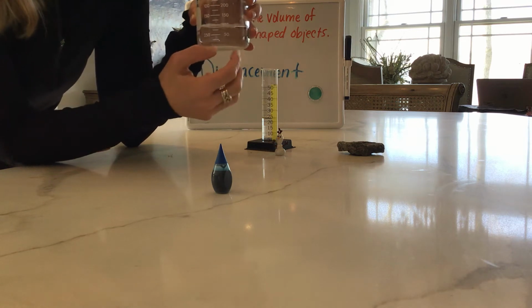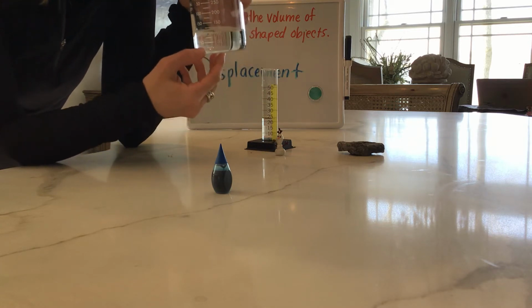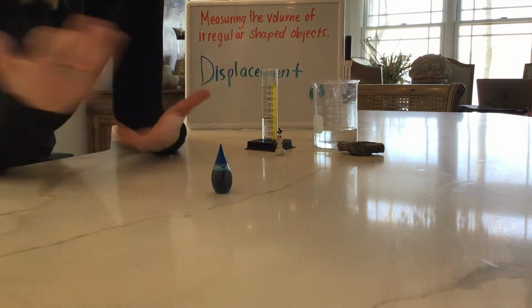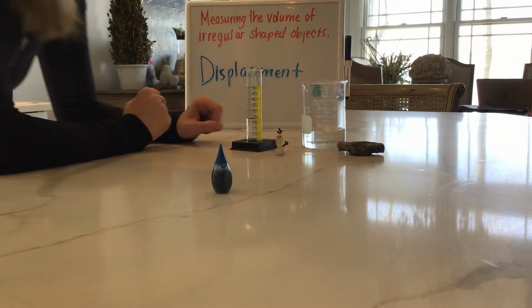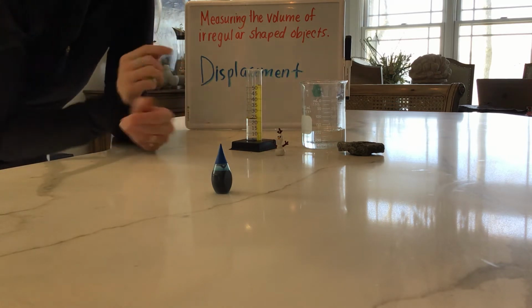So when you're looking at a measuring tool for liquid, you always have to look carefully at what the number is on the beaker, because sometimes it could be 5s, sometimes it could be 25, sometimes it could be 100. So you just have to pay close attention to that. So today we're going to be learning about something called displacement.